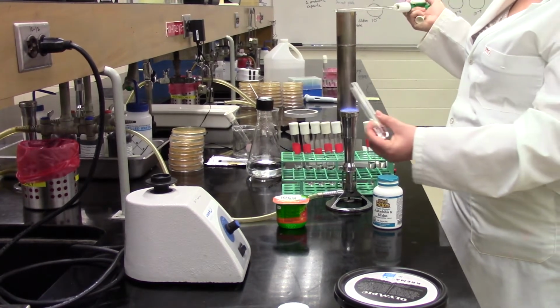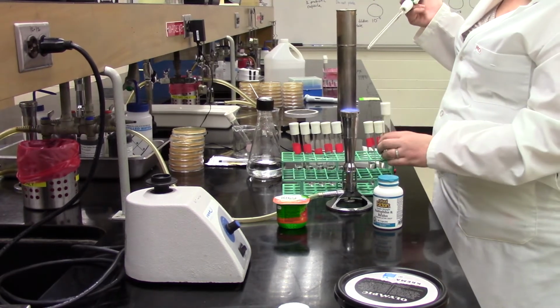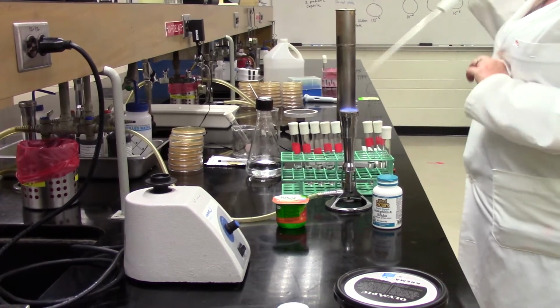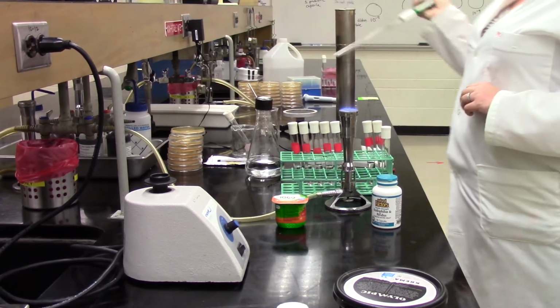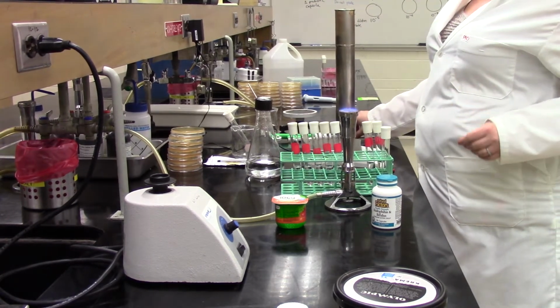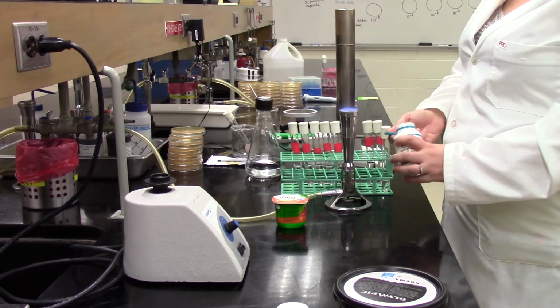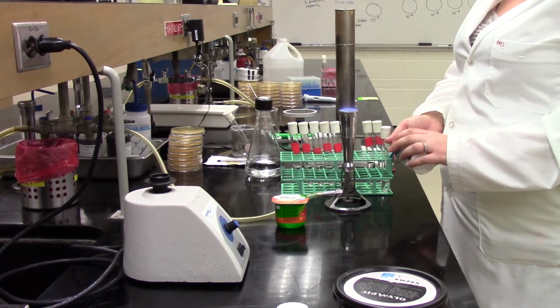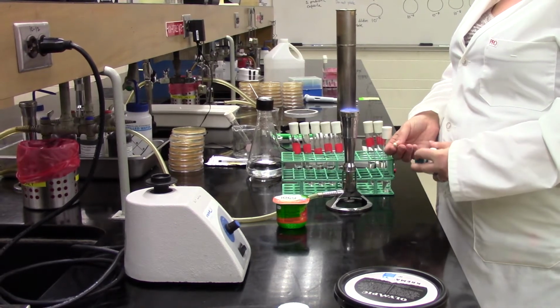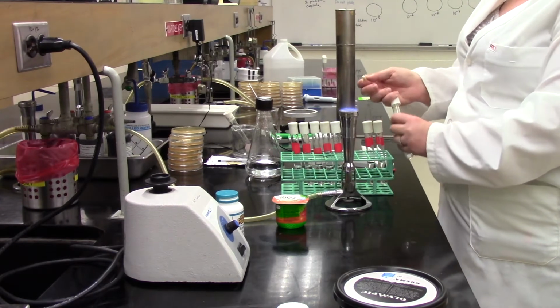Notice how, even with that pipette aid, the green thing that lets her drop the water, she's still holding the cap from the test tube in her hand. She flamed the neck of that test tube to make sure the top of that test tube stays nice and sterile. So she's working right within the sterile zone, even though she's getting out a capsule that obviously came from the grocery store. But once again, you want to just prevent anything getting in there.